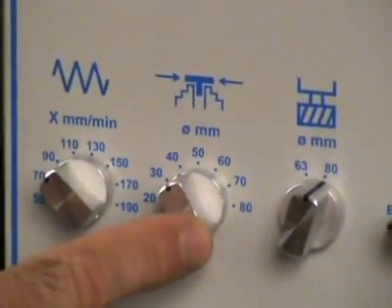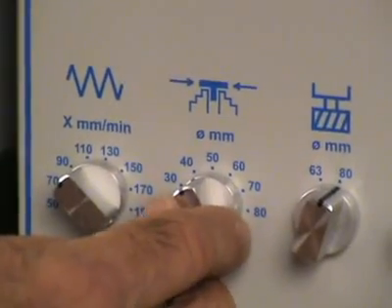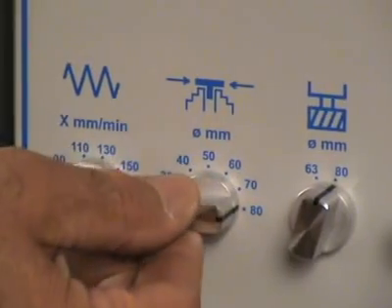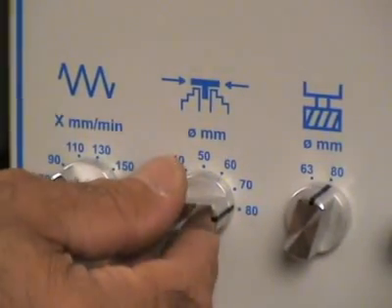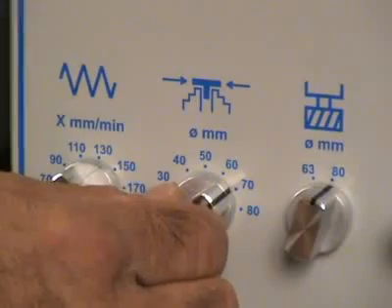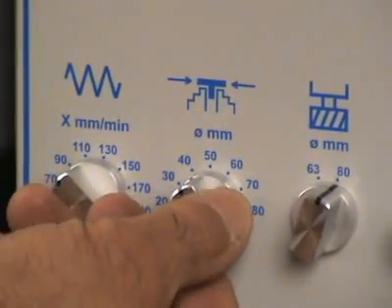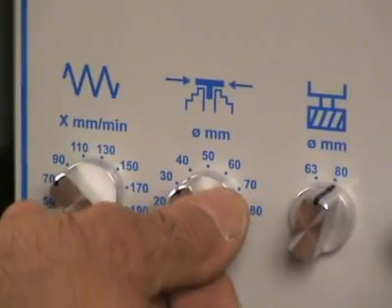This switch is set to the next bigger diameter marking of the actual sample size. The sample moves in fast mode to the cutting head and with the preset feeding speed under the cutting head. This feature is a time optimization for the whole milling process.